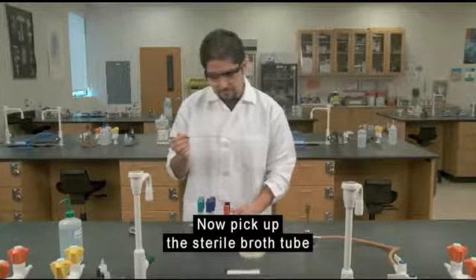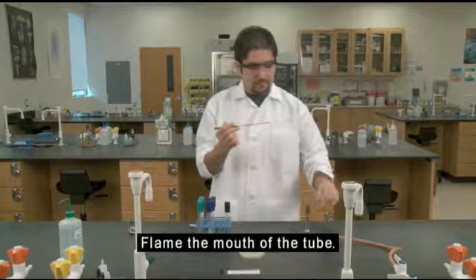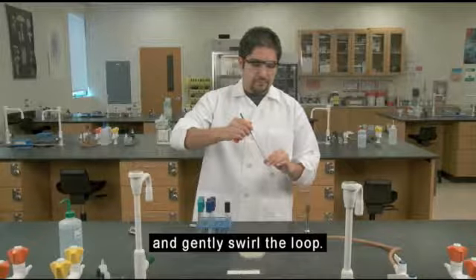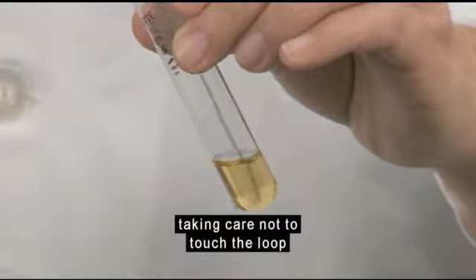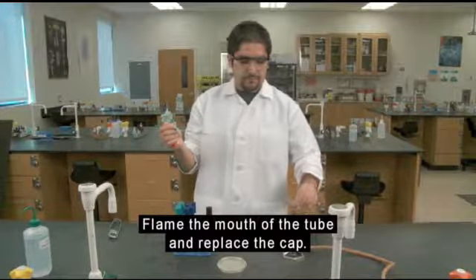Now pick up the sterile broth tube that will receive the inoculum. Remove the cap. Flame the mouth of the tube. Insert the loop containing the inoculum into the sterile broth and gently swirl the loop. Then, remove the loop from the tube, taking care not to touch the loop to the side of the tube. Flame the mouth of the tube and replace the cap.